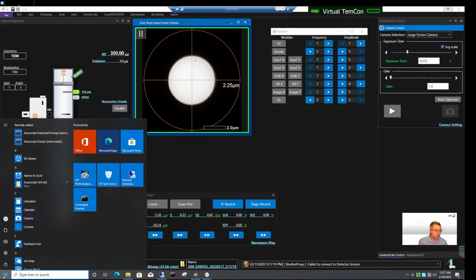And here we want to create an application that is going to control whether the beam is parallel or not. So we want a simple graphical application that is able to capture the state of the beam. I mean here the CL3 value or the beam spread. And then this application should be able to set this value on demand.